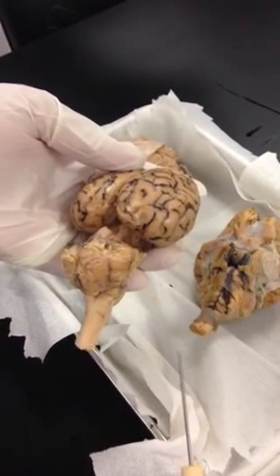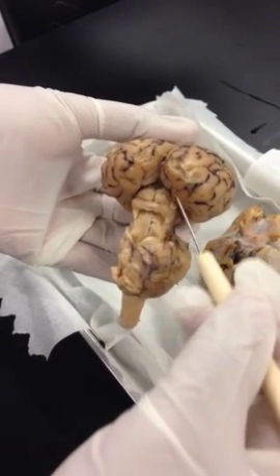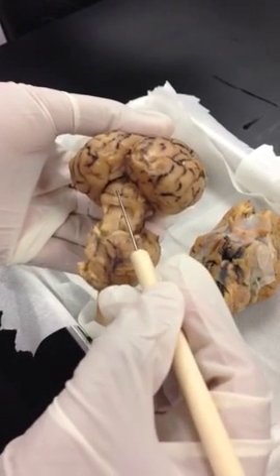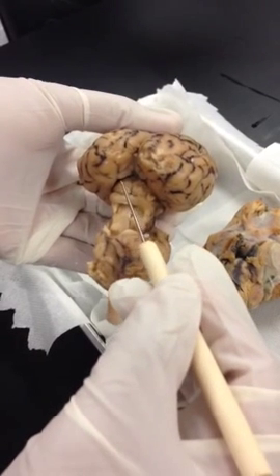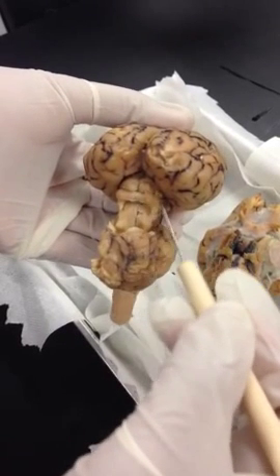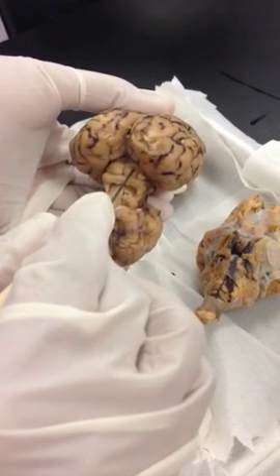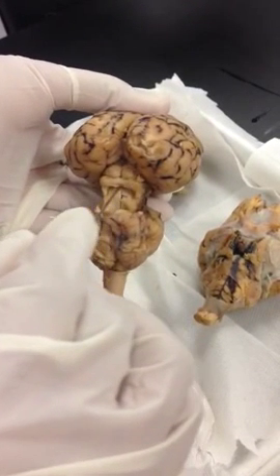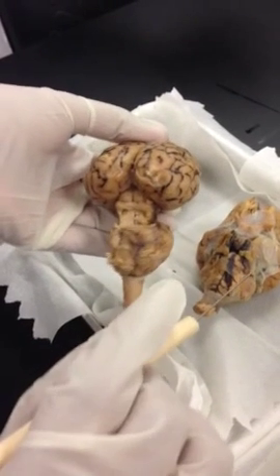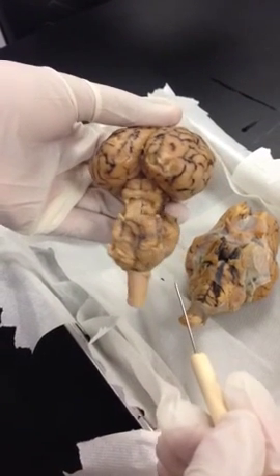V-E-R-M-I-S. Superior colliculi of the corpora quadrigemina. Corpora quadrigemina is all these four structures together. So you have two colliculi, colliculus singular, superior colliculi, inferior colliculi, two superior, two inferior, four of them together we call corpora quadrigemina. If you point to just one, this will be right superior, left superior, right inferior, and left inferior. Remember, colliculus is singular. Inferior colliculi. We did that, the inferior colliculi.